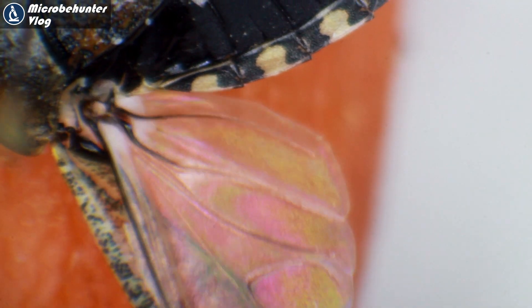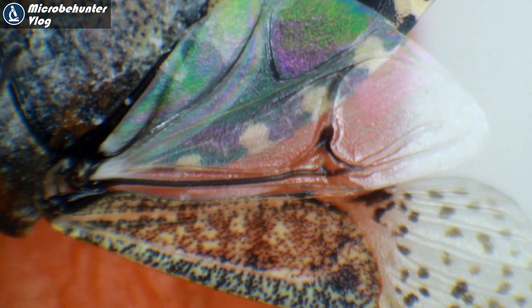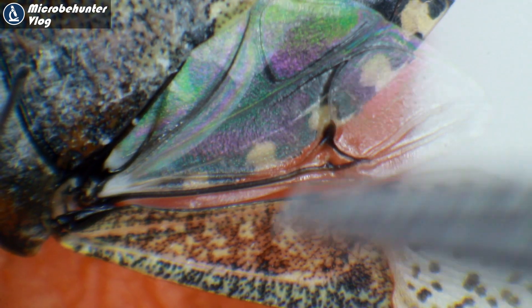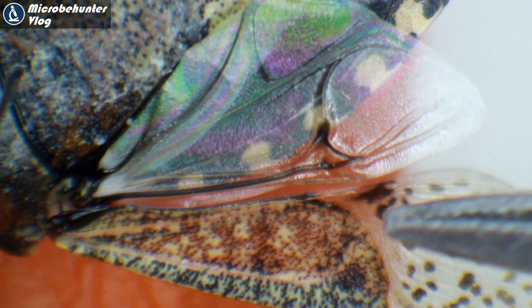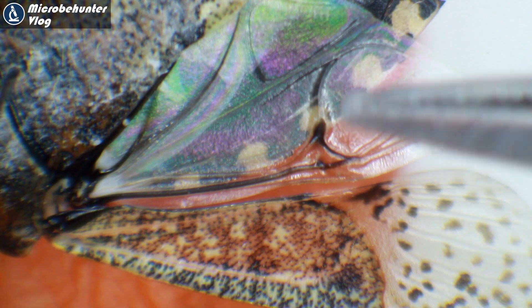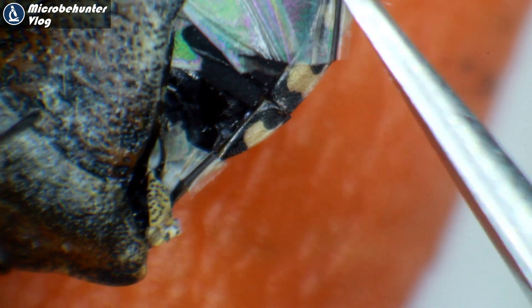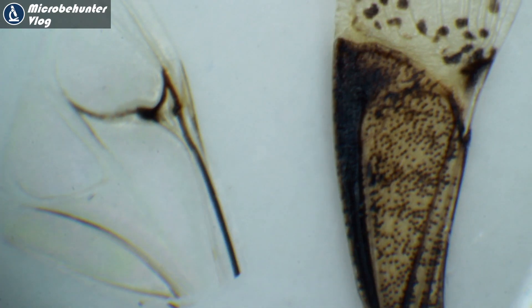The second pair of wings is very thin, membranous, and quite soft. Ladybugs — which we now know are beetles — also use their second pair of wings for flying; the first pair is the defining characteristic. The front part of the first wing is very hard. I'm cutting it off now to put it under my compound microscope, which takes a little patience. Off it is, and now I'm cutting off the second pair of wings as well.